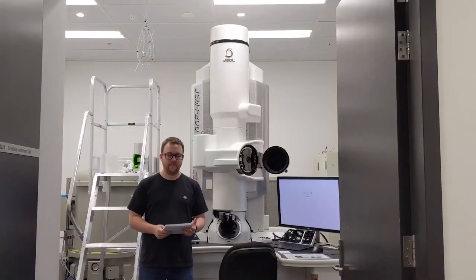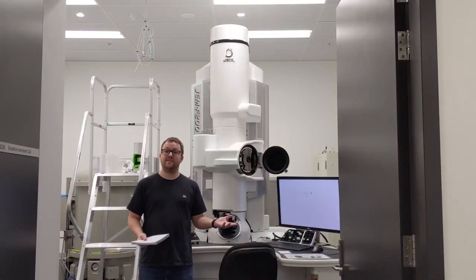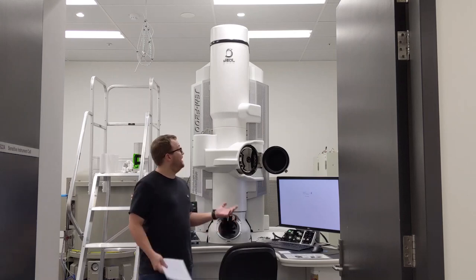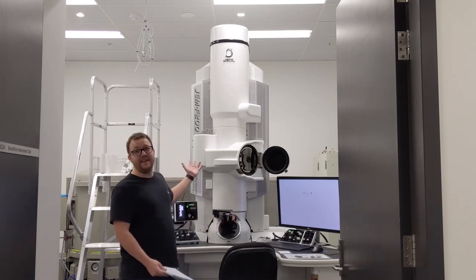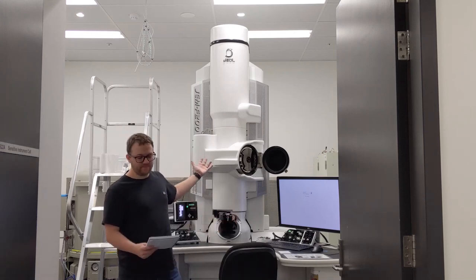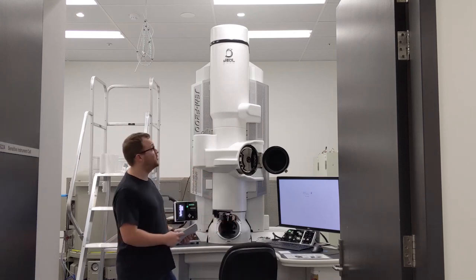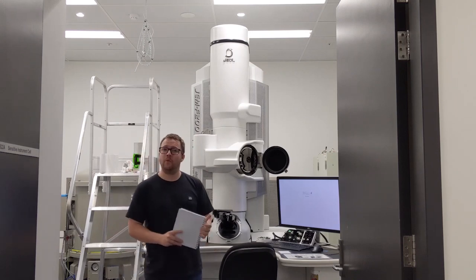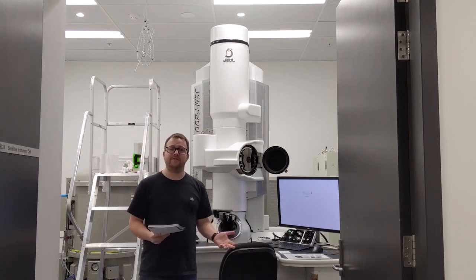This sample is now ready to go into the TEM. We are now standing in the microscope room, and here we have the electron microscope. It's about 2.5 meters tall and weighs about 2 tons.